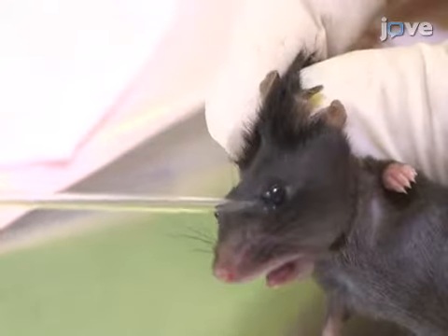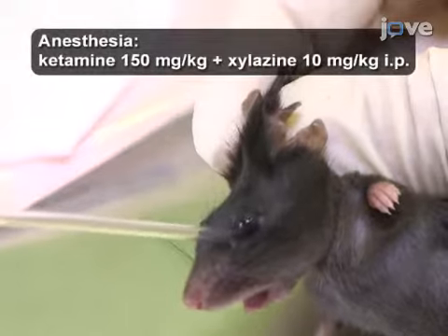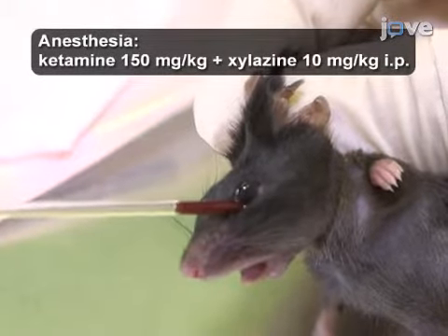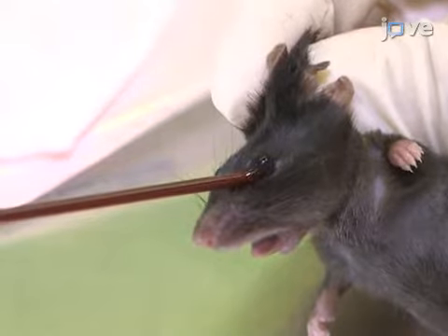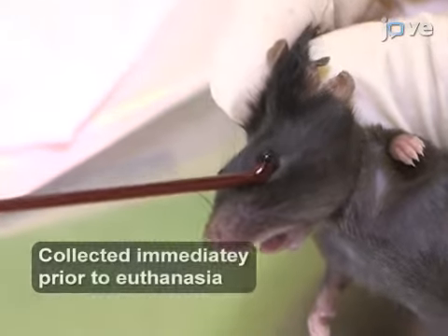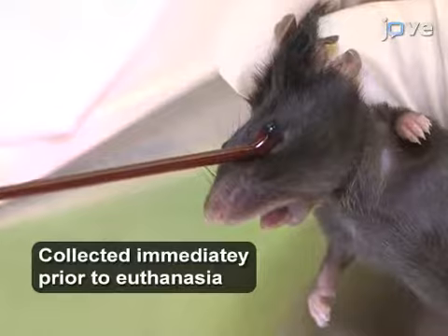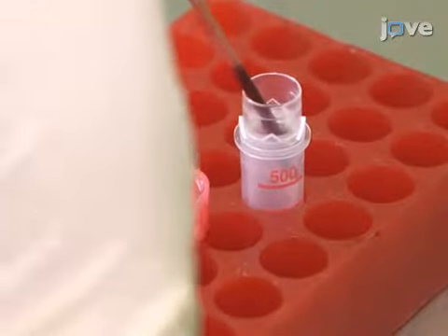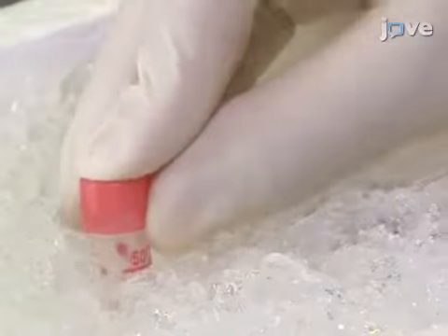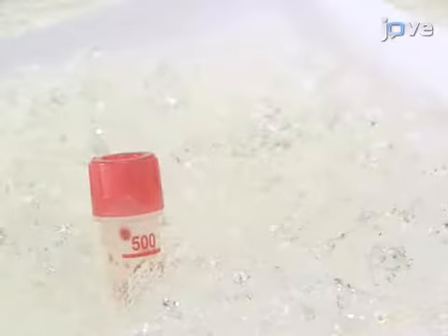17 to 19 days later, insert a capillary tube into the medial canthus of the eye of the anesthetized leukemic animal. 100 to 200 microliters of blood will be drawn from the orbital sinus into the capillary tube. Remove the tube and control the bleeding with the gentle application of a sterile gauze sponge onto the eye. Then transfer the blood into an EDTA tube and store the tube on ice until the mononuclear cell isolation.